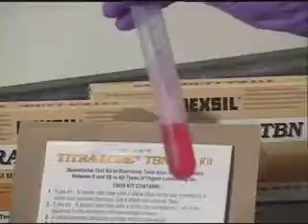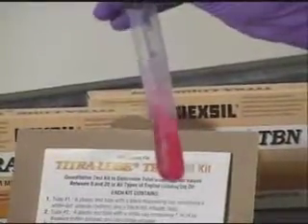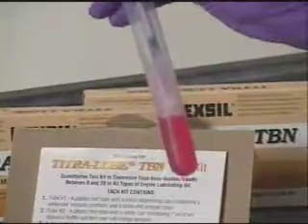At first, a yellow color will appear and disappear rapidly. When the yellow color appears and fades slowly, you are getting close to the endpoint.